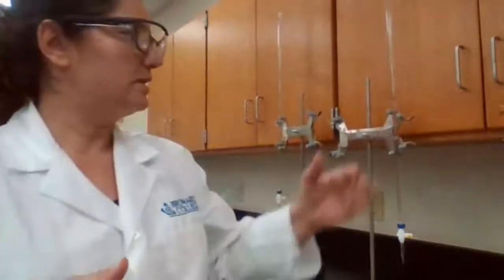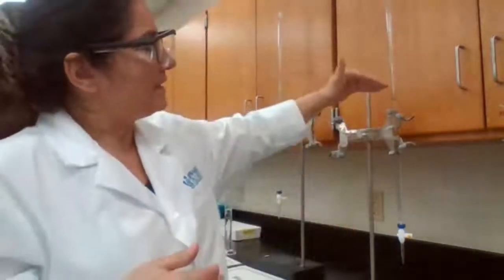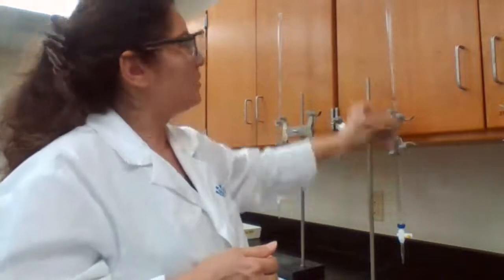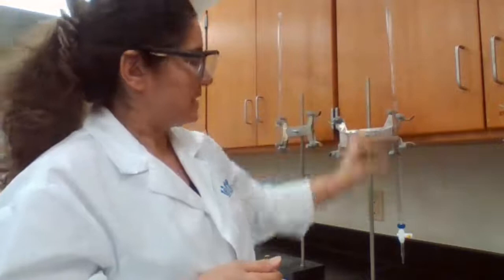So we could say it at the mark of 23.65 milliliter, but we cannot say there are 23 milliliters of the solution in there, because it starts from 0, unless you subtract that number from 50 and say that much liquid. But that's not the purpose of using a burette. The purpose of a burette is reading the level. If we start from 10 and then open the stopcock and transfer 10 milliliters out, it's going to come to 20. So the difference between 20 and 10 is the volume of the liquid being transferred out.